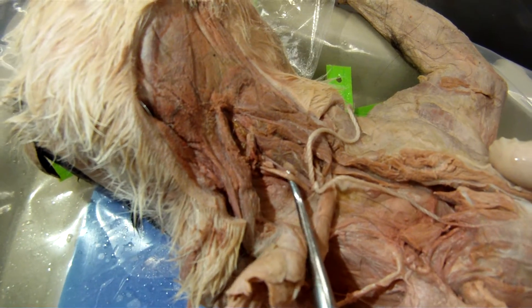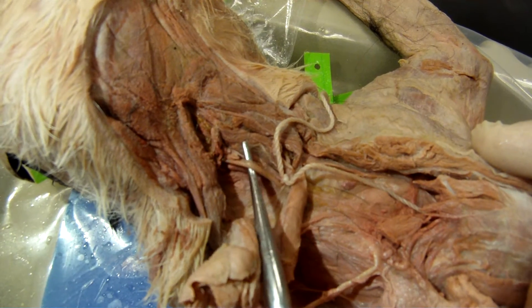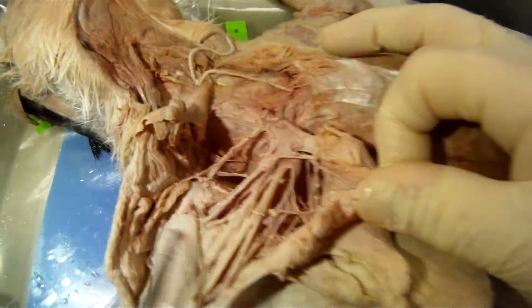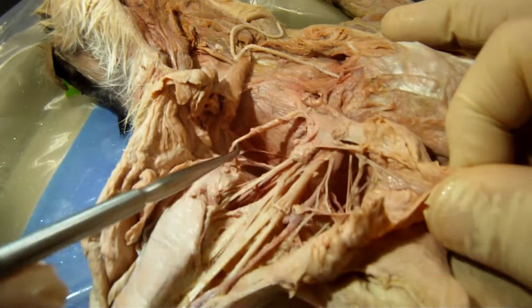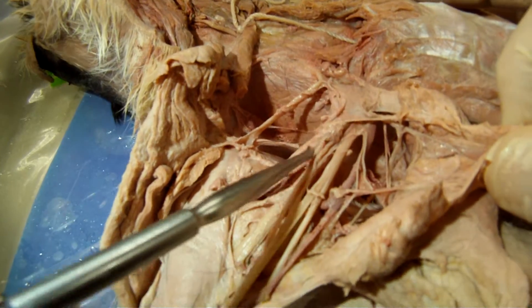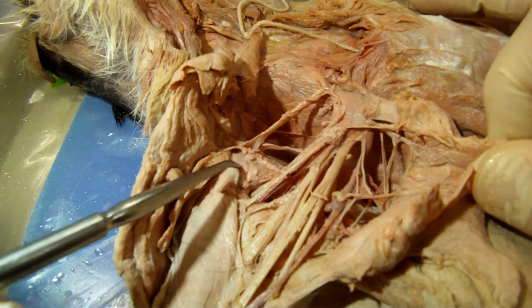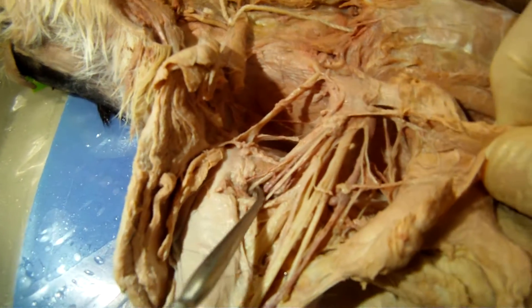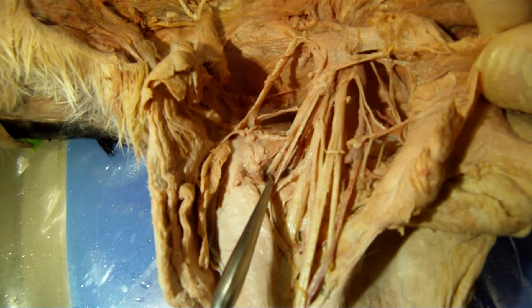This is going to be the vagus nerve right here, right next to the carotid that's tied off. We're going to move down to the suprascapular, and then the subscapular, and then you find the landmark of the coracoid process, and then this is the axillary diving inside. It's axillary right there.